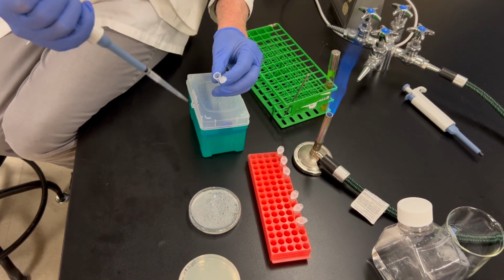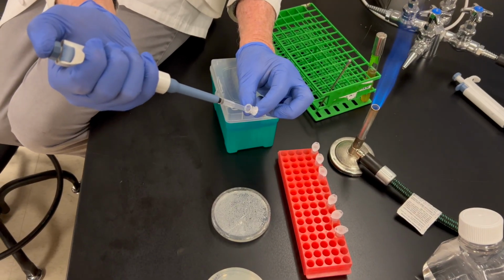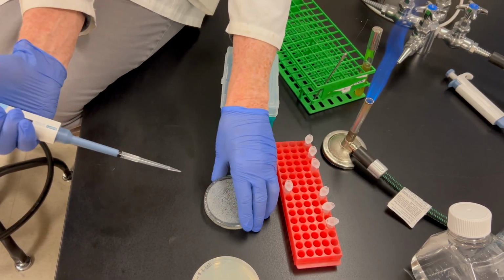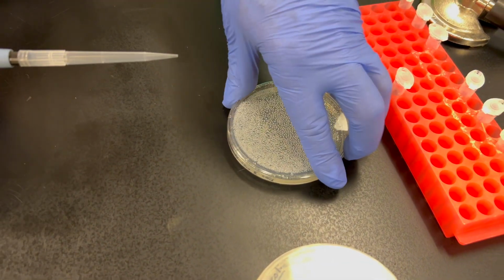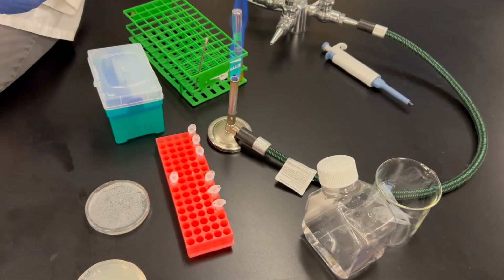And we'll open this up. I have this set on 100 microliters. I'll mix it a few times, nice and gently. We get 100 microliters in our pipetter. I'm just going to lift this lid up a little bit, and I'm going to put all of that on the plate. Okay, and then we'll get rid of the pipette tip.